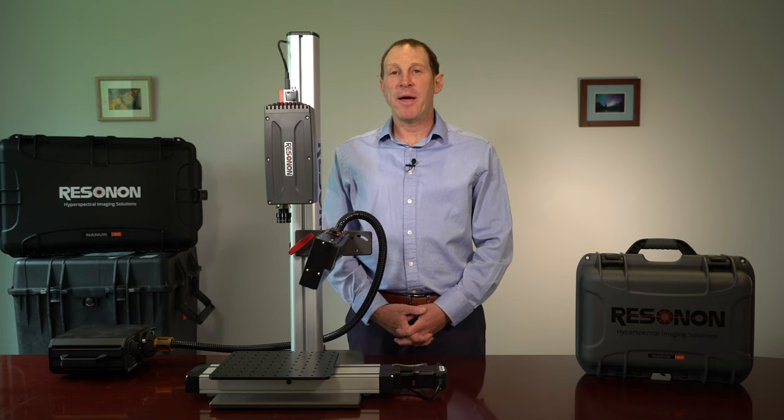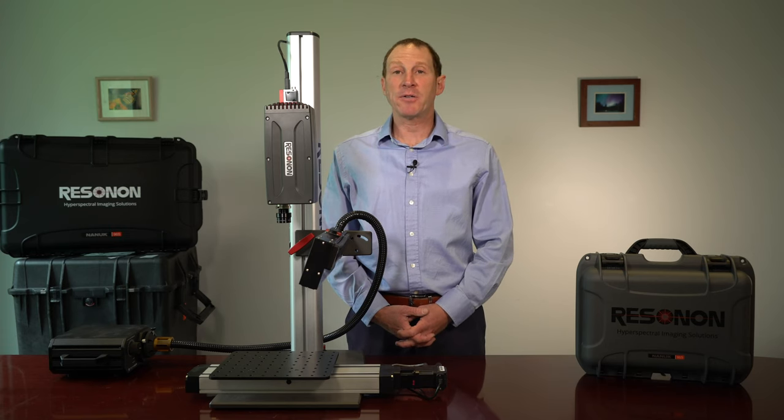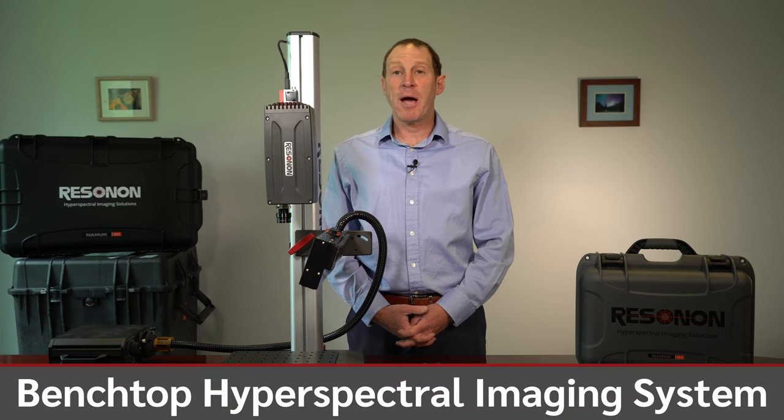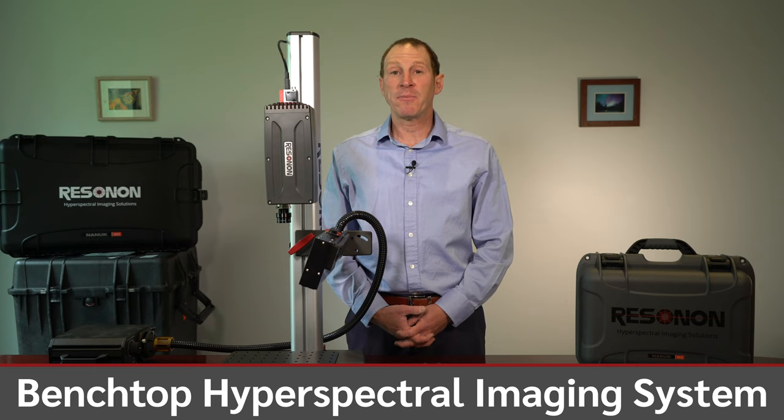Hello, I'm Adam and today we are going to discuss Resonon's Benchtop hyperspectral imaging system.